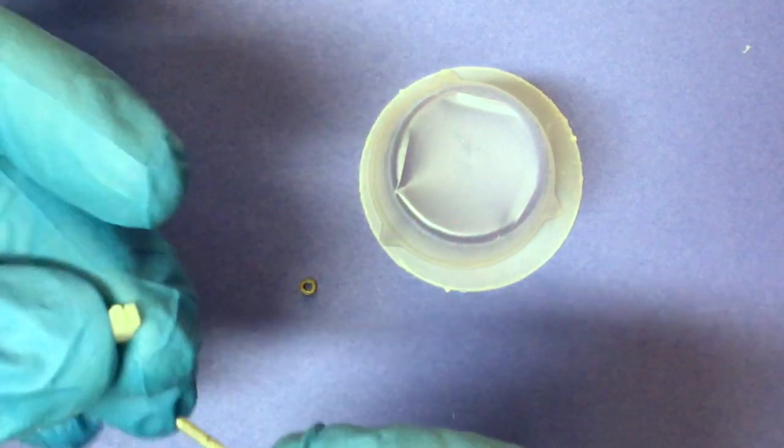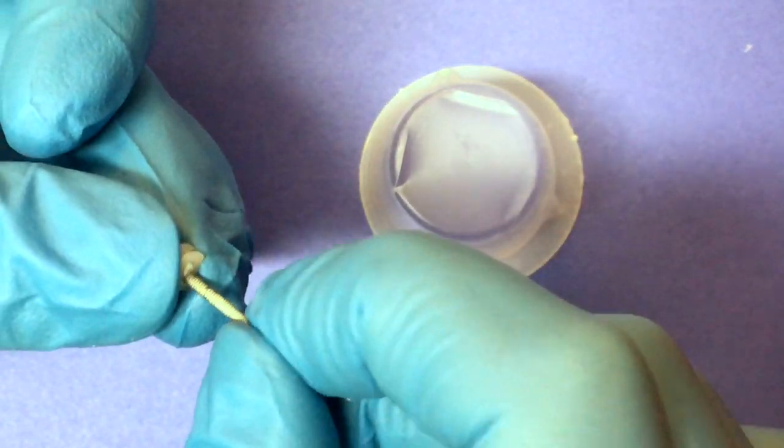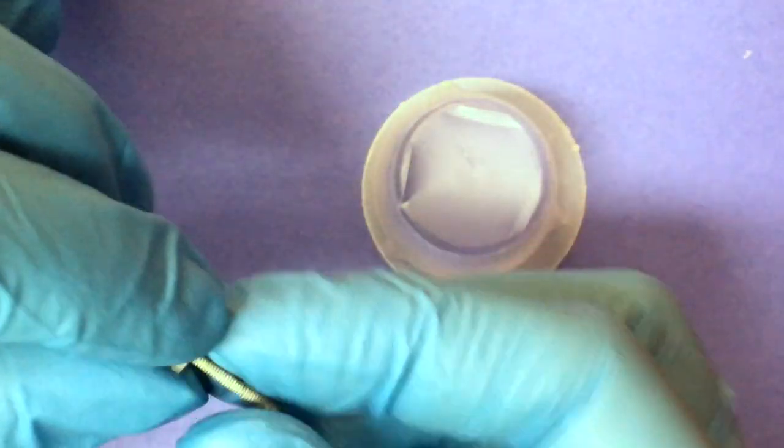Once this is complete, the first thing you're going to do is to take the white box and essentially screw it all the way down until it reaches the tip of the hex screw.